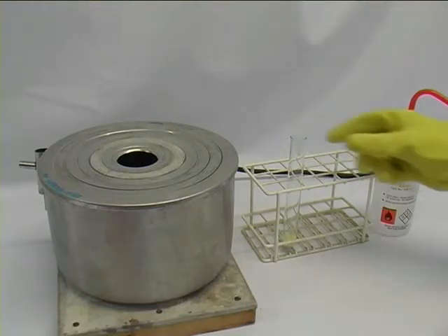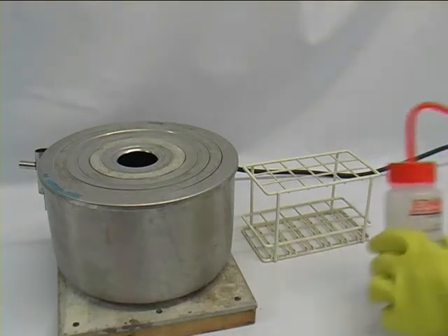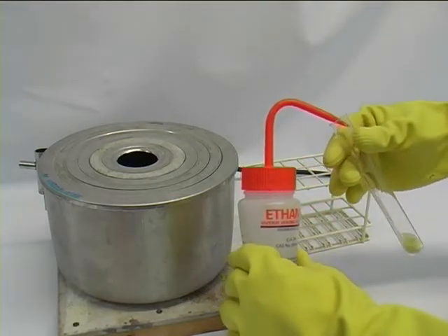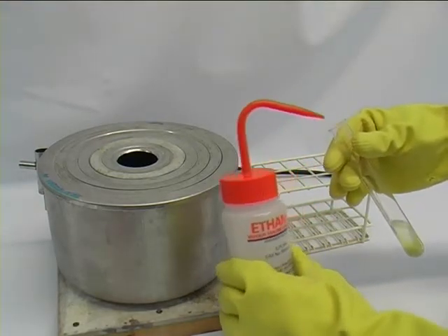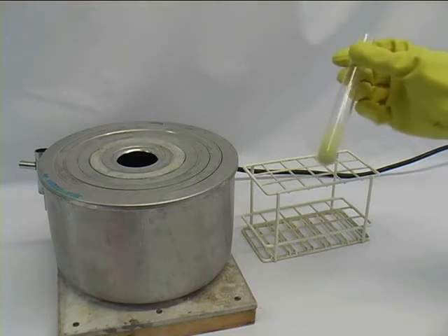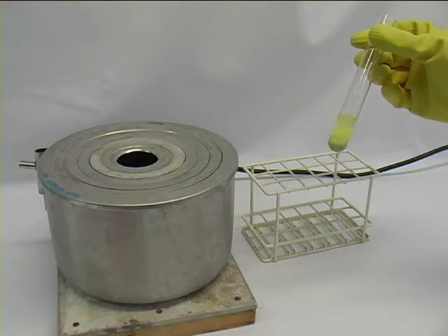We start with our mixture and we want to dissolve that in a little bit of cold solvent, in this case ethanol. As we can see, when we shake the test tube, the cold solvent doesn't dissolve it, which means we have to heat it up.